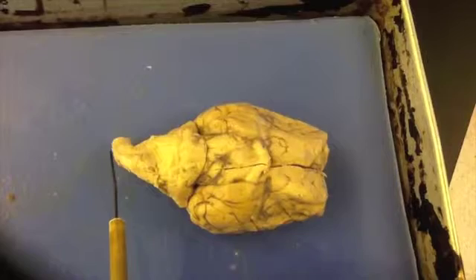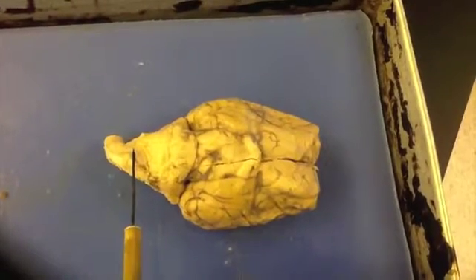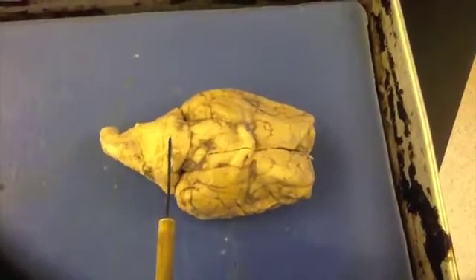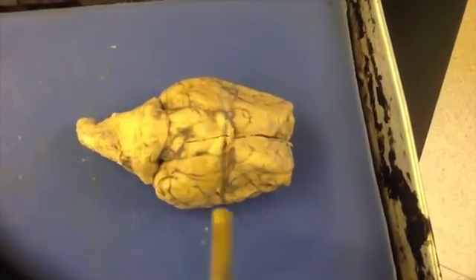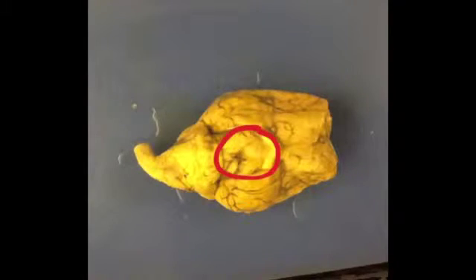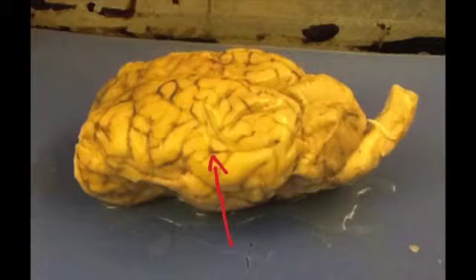This is the spinal cord. This is the medulla oblongata. This is the pons. And this is the midbrain. The midbrain makes up a small part of the brainstem. It is composed of canals called cerebral aqueducts, fibrous tracts called cerebral peduncles, and rounded nuclei called corpora quadrigemina that function as reflex centers with vision and hearing.